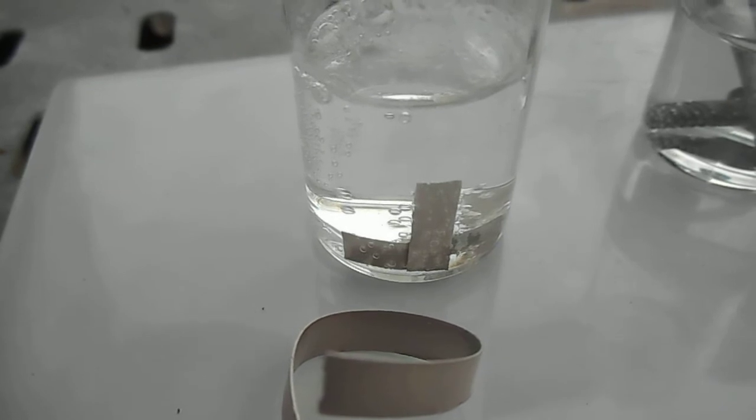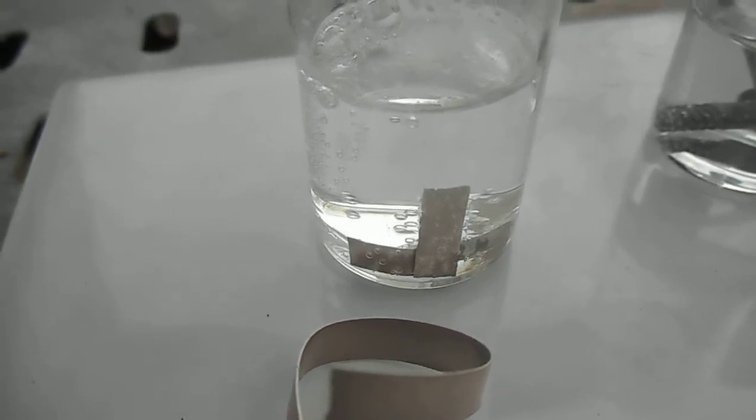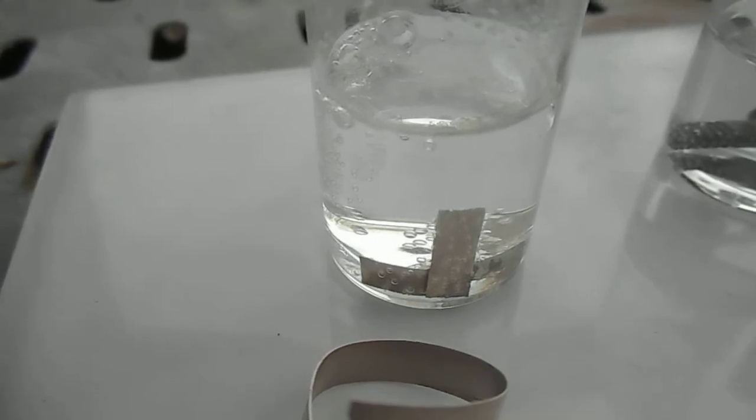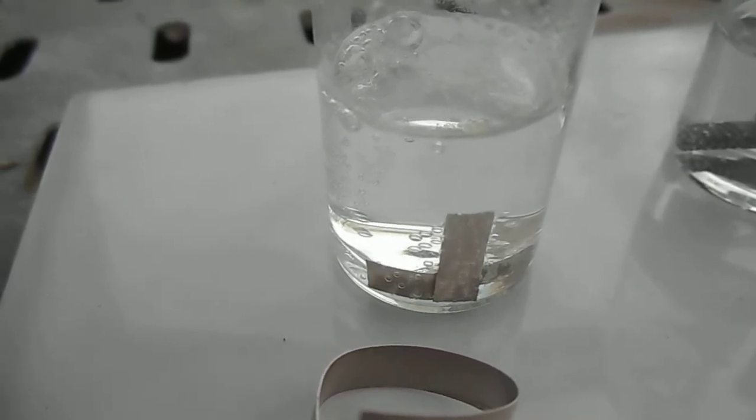Reaction of four metals with vinegar. After about four hours. The first metal here is magnesium, and you can see that the reaction has slowed right down.